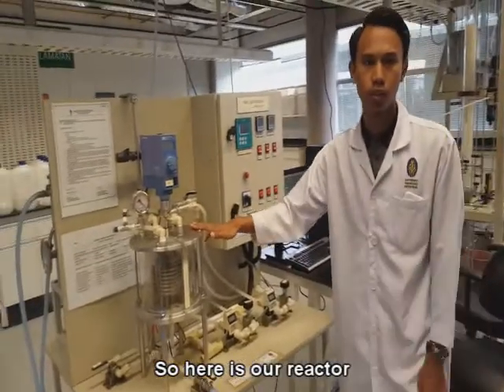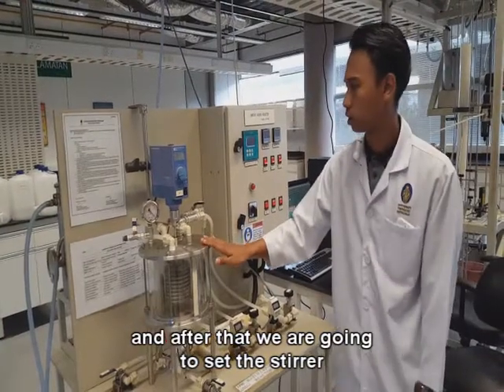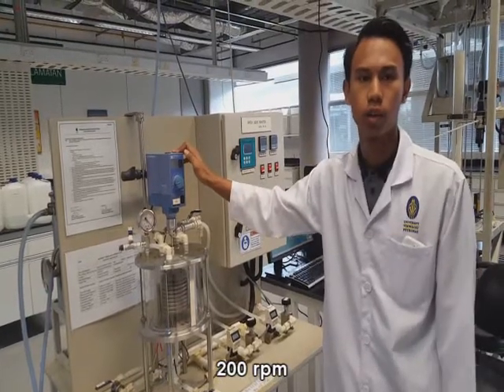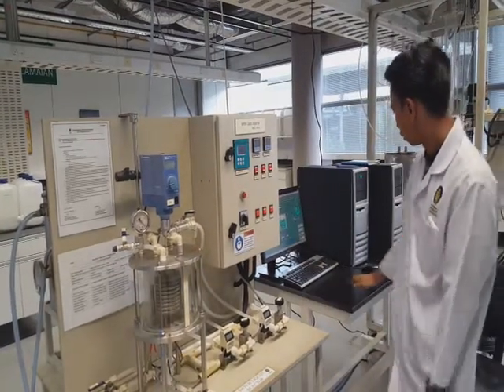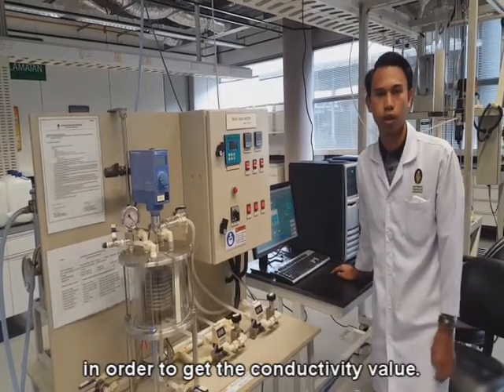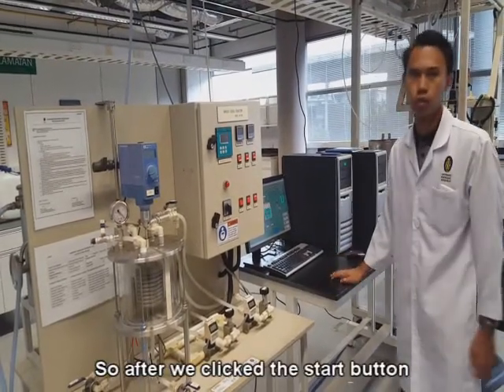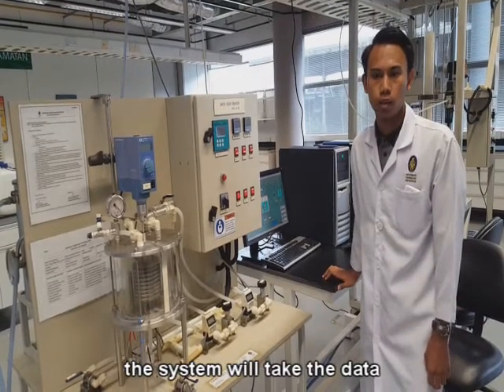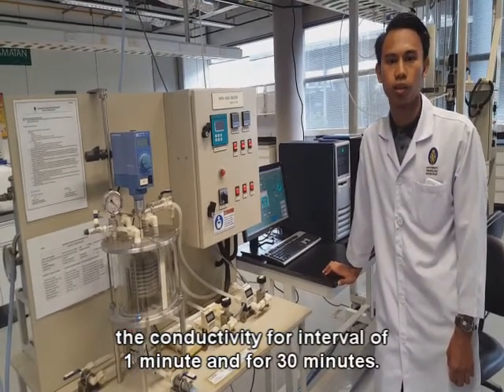So here is our reactor, and then we're going to pour the solution inside of it, and after that we're going to set the speed of the stirrer at about 200 RPM, also known as rotations per minute. After that, we quickly click the start button in our DAS system in order to get the conductivity value. After we click the start button, the system will take the conductivity data at an interval of 1 minute for 30 minutes.